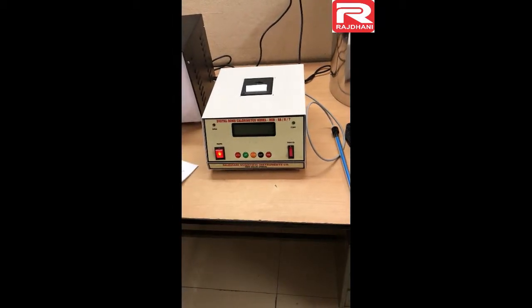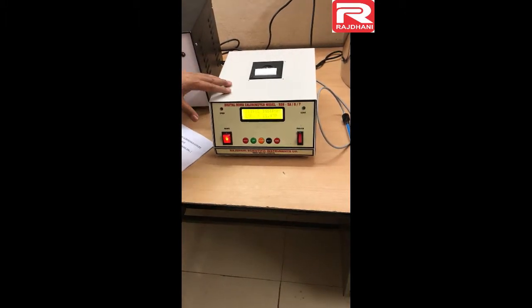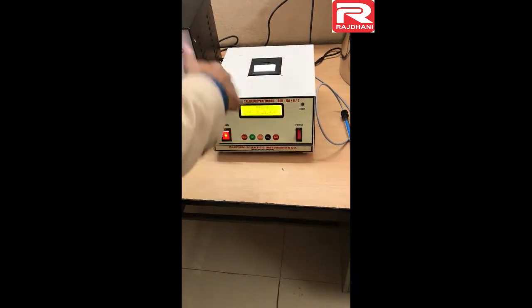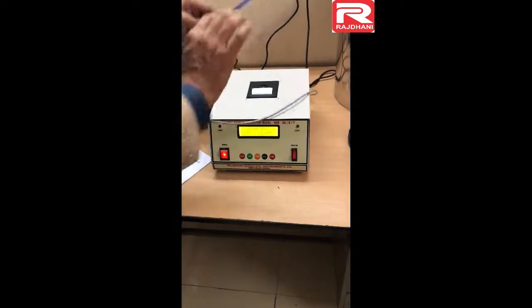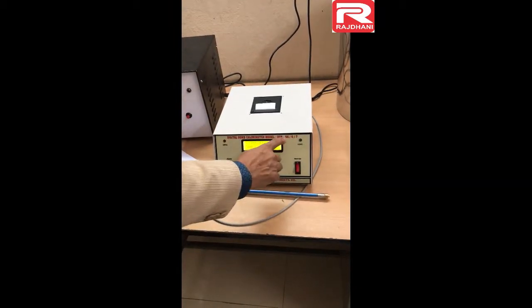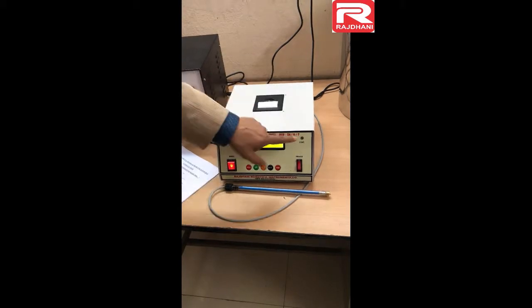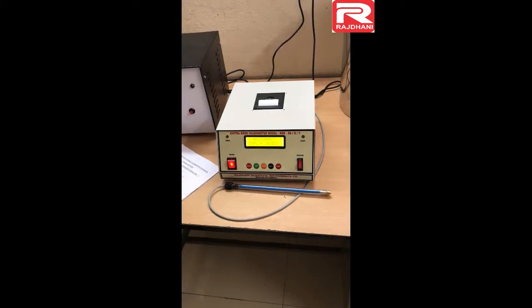When you switch on, a temperature reading will appear. This unit has two purposes: first, it is the firing unit — by pressing the fire button the sample will burn; and second, it has a digital temperature indicator. The model number of this unit is written as 5A, 6, and 7. Generally the same unit is used for three models — for model 5A the printer is not included, but for models 6 and 7 the unit is the same.